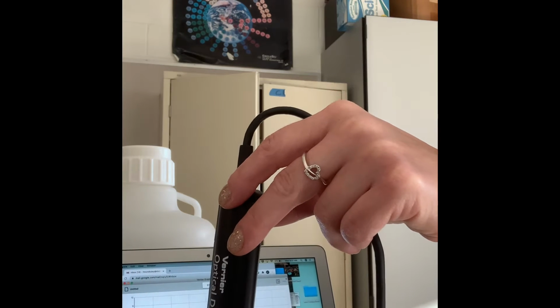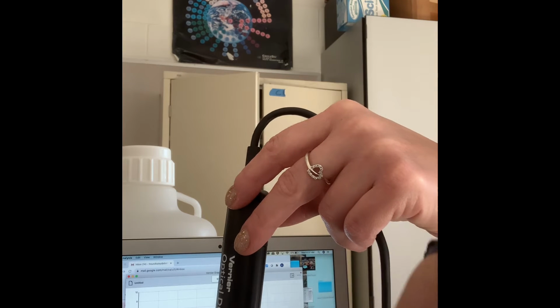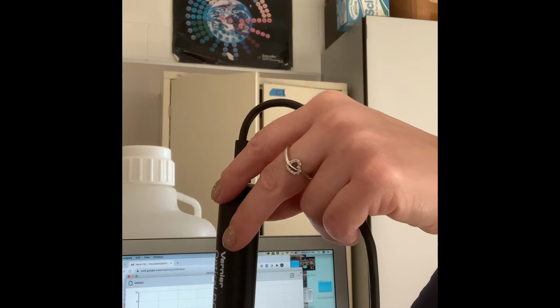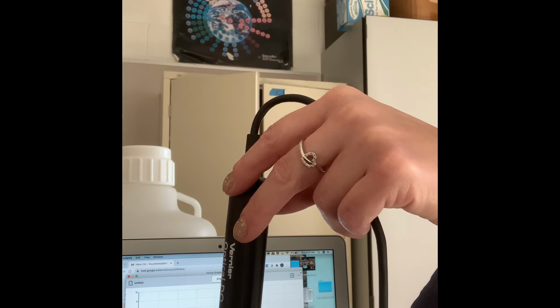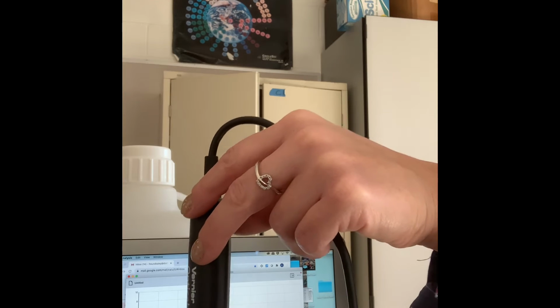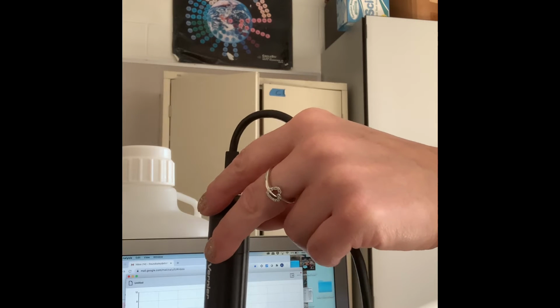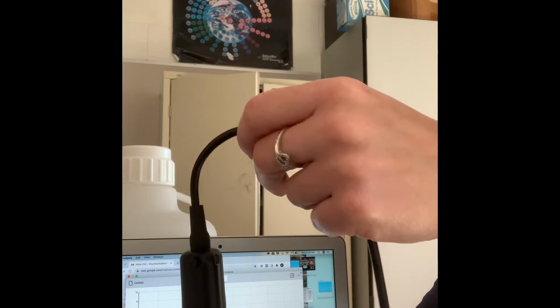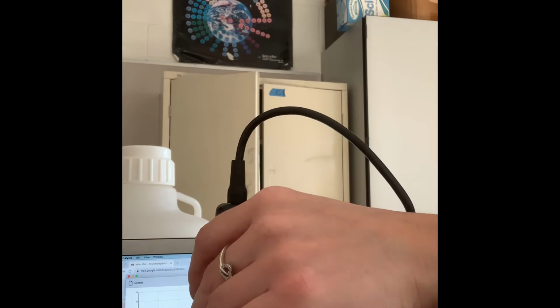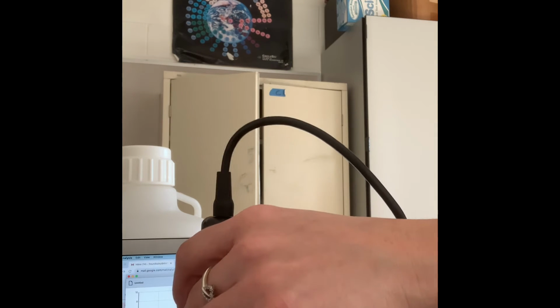So I'm just gonna wait. You can kind of see the line here, and I'm just gonna wait until I get a nice steady line and it's not increasing or decreasing anymore. And then I'm gonna go ahead and take the average of that line. And as you hold it in here, you want to kind of move the probe around so that you're constantly sort of bringing fresh water to the probe.